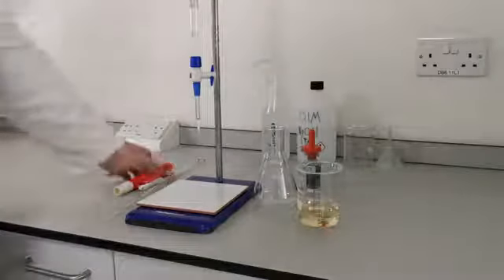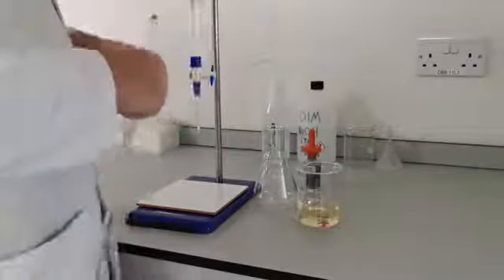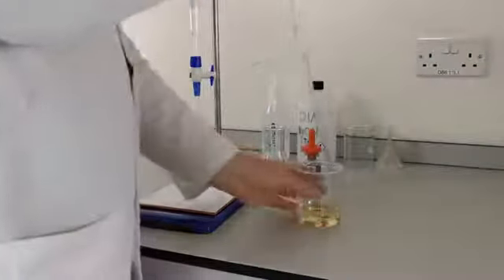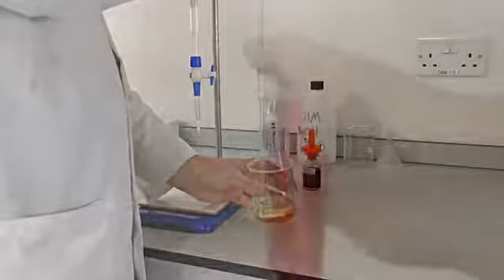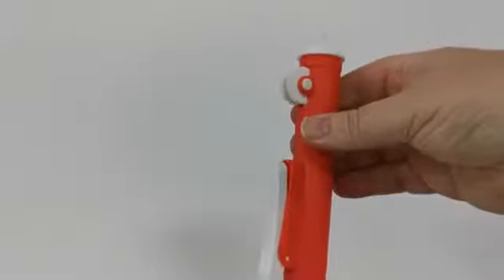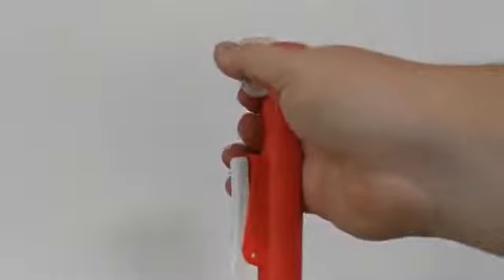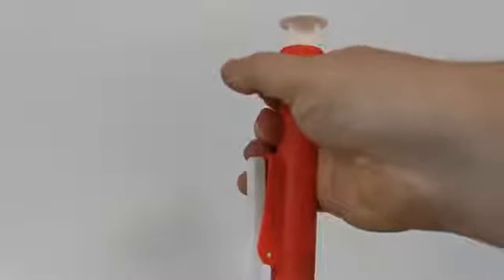Now that your burette is ready to go, we need to add 10ml of our sample to a conical flask. To do this, take your volumetric pipette and insert it into the pipette filler. Place the tip of the pipette into your beaker and start to draw the solution into the pipette. To use the pipette filler, simply scroll the wheel downwards using your thumb, avoiding pressing the button below the wheel.